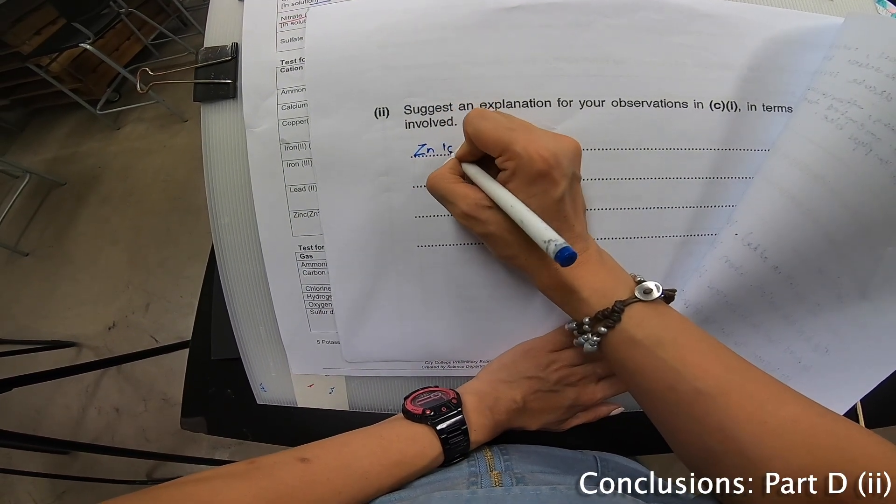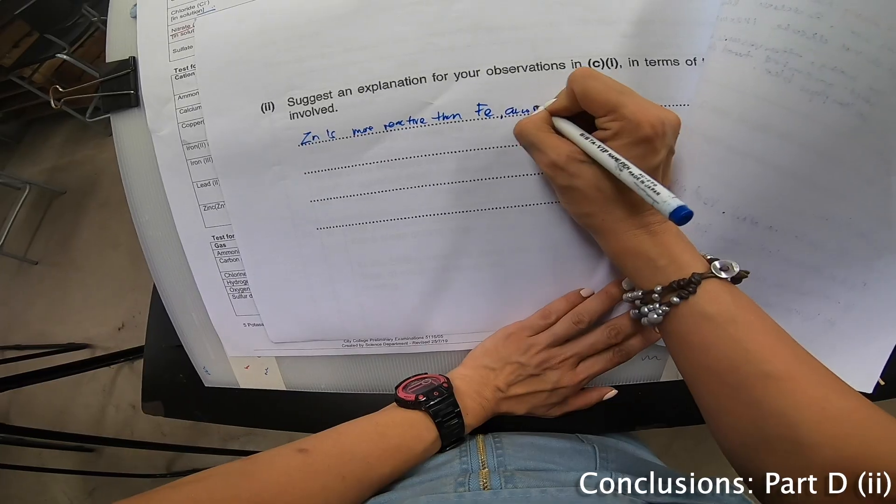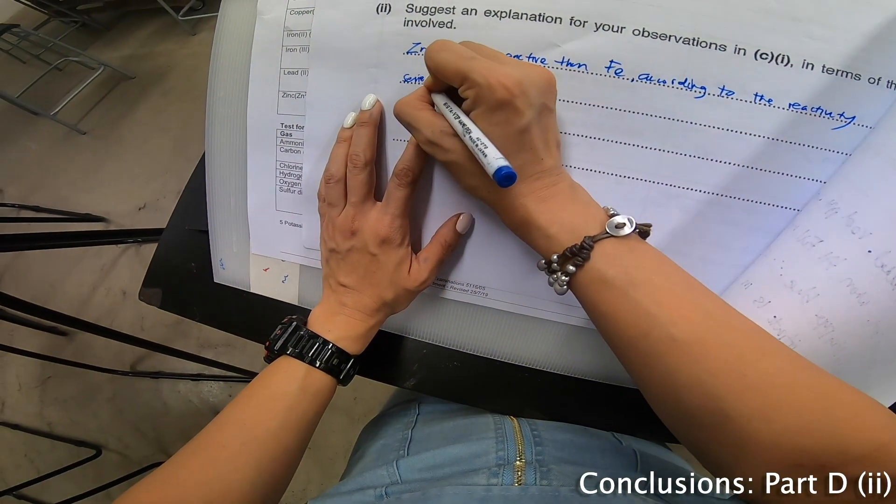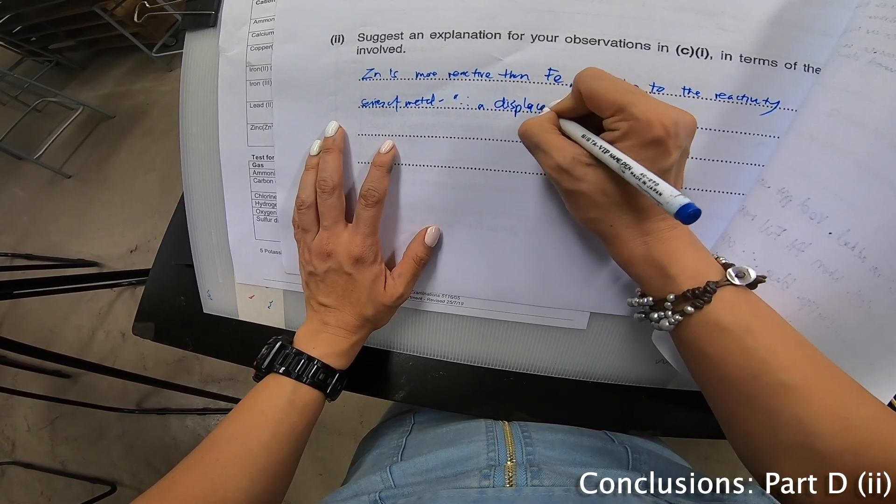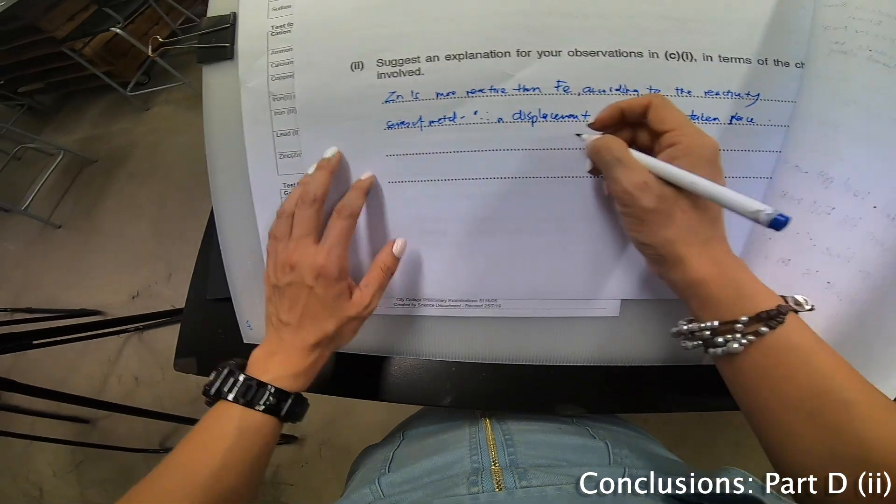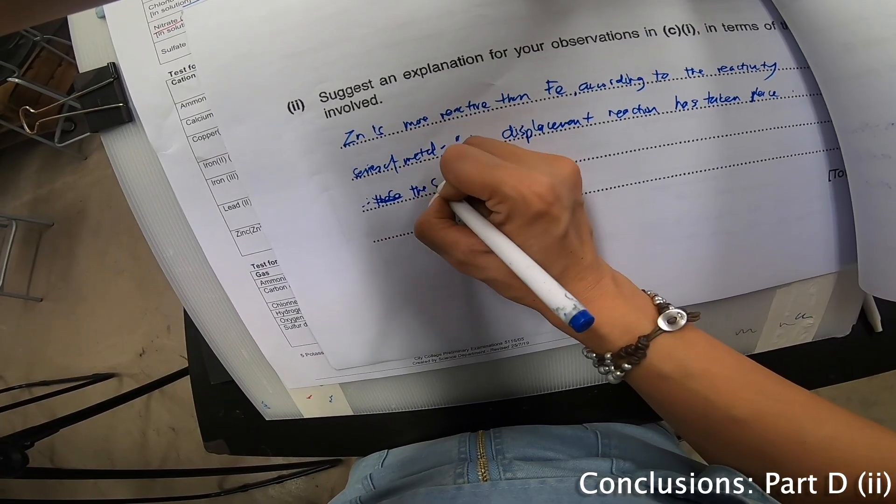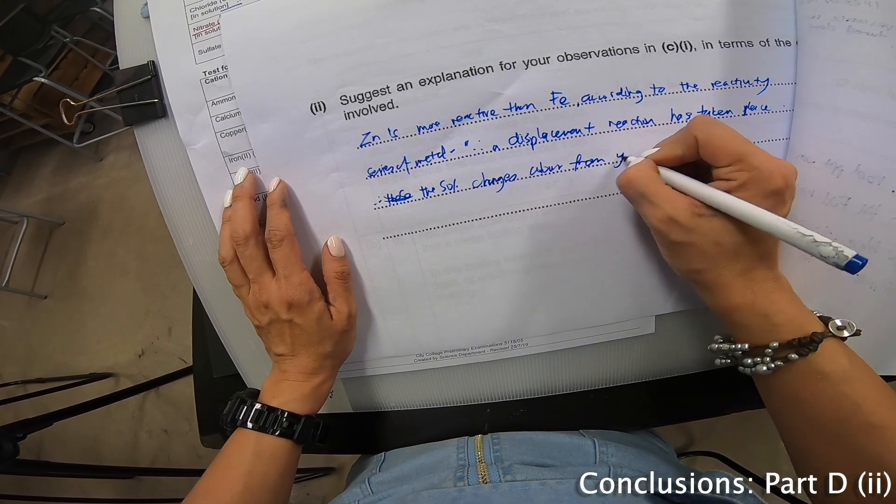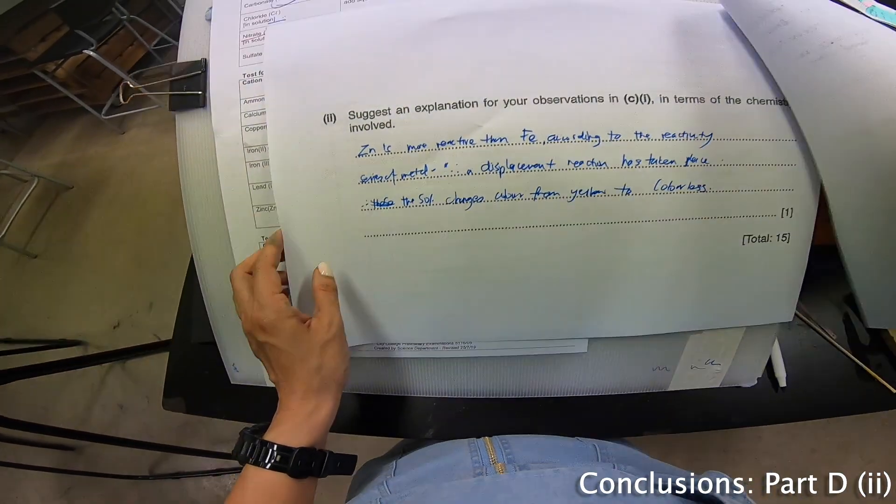Therefore, the solution changes color from yellow to colorless.